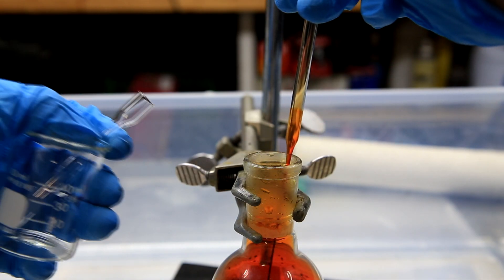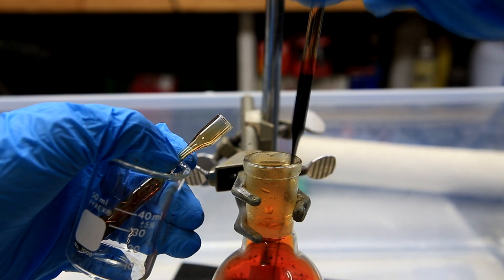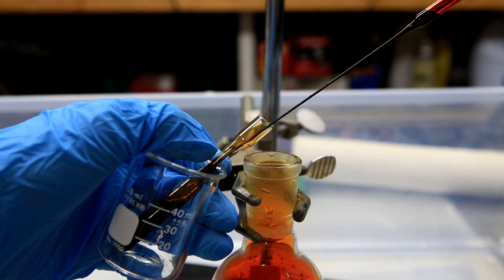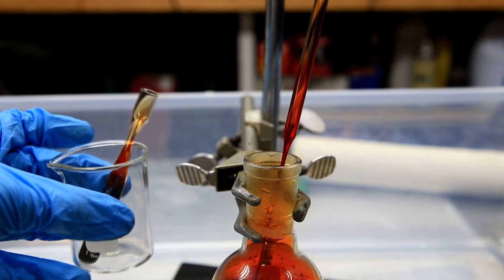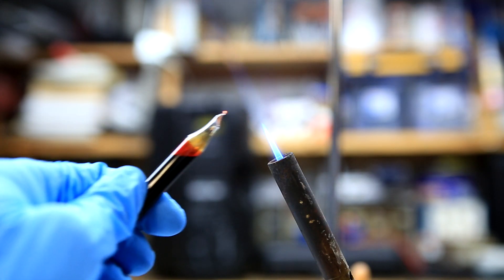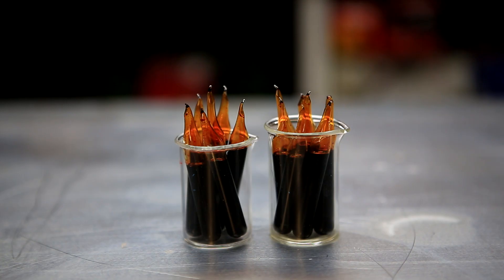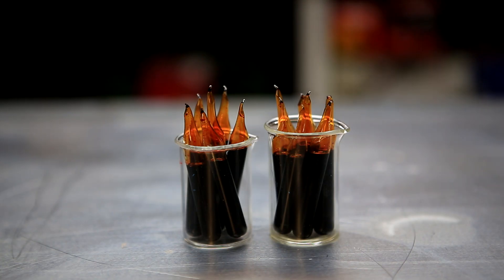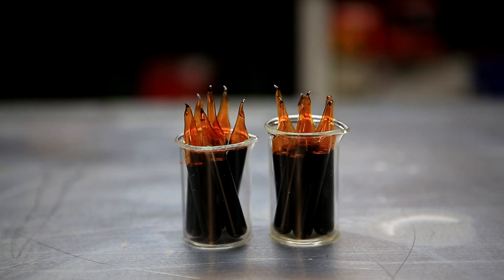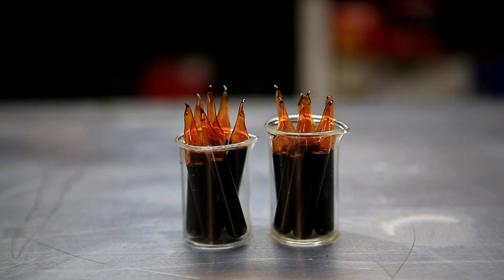The storage of bromine is extremely difficult and it will leak out of almost any container. The best option for bromine storage is an ampoule. Using a Pasteur pipette, the bromine was carefully transferred to homemade ampoules made from test tubes. After the bromine had been transferred to the ampoule, it was sealed using a torch. I chose to use several different small ampoules so I could use a small amount many different times. These ampoules are stored in a mixture of sand and sodium thiosulfate in a container outside. If any of these ampoules were to pop or break indoors, it would be a very big problem.